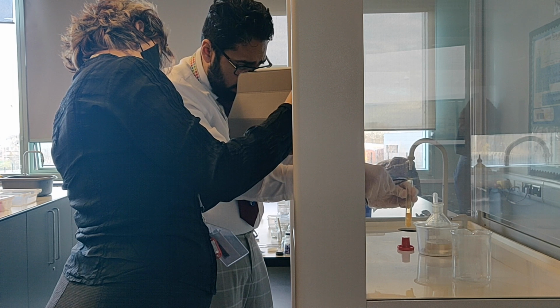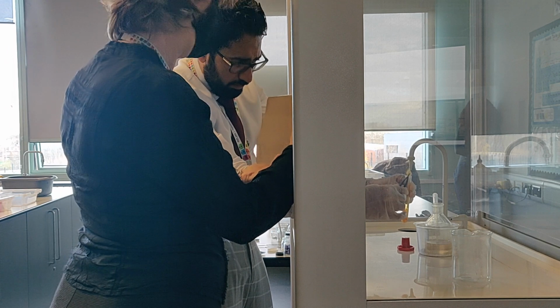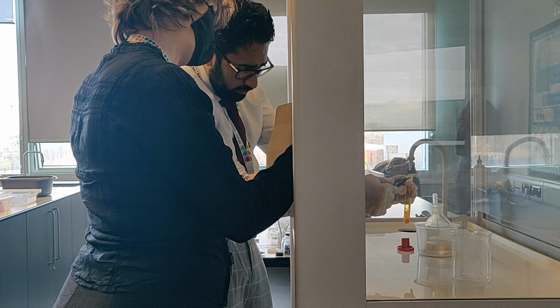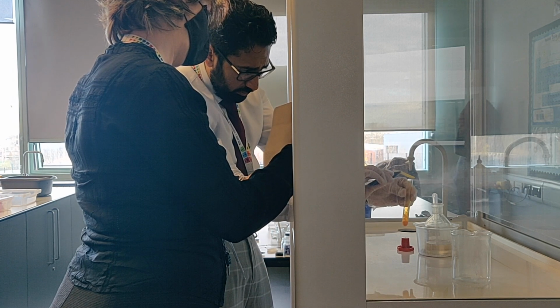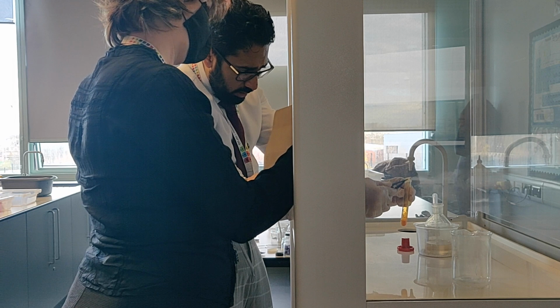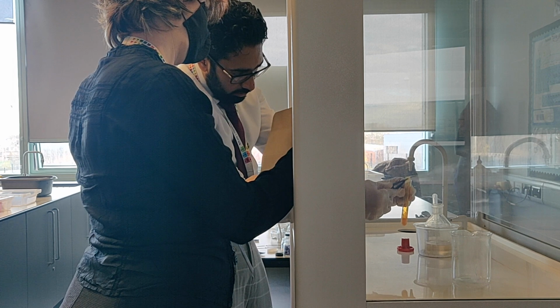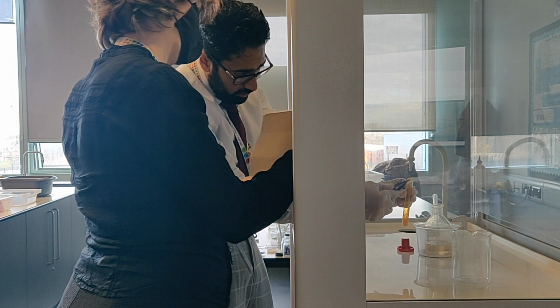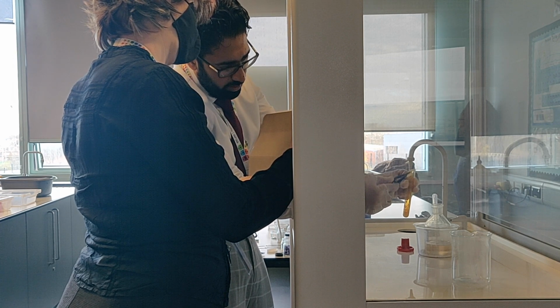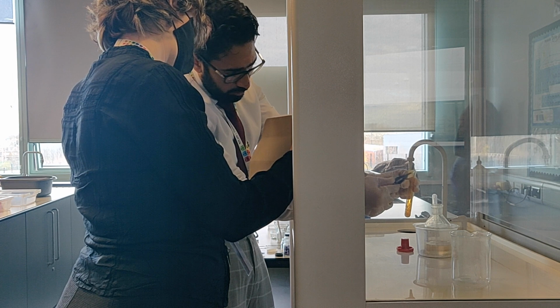Yes, it's gone to a yellow colour from the orange colour that it started with. So you should be able to see the yellow colour that's been produced. These are the redox reactions that came up in the test. Again, much gas is being given off, and the filter paper should change to green.